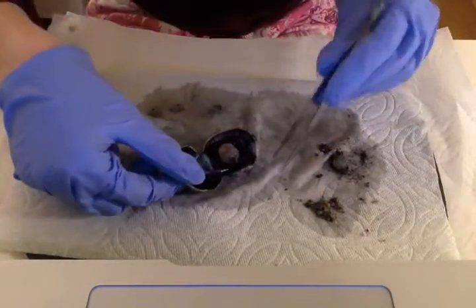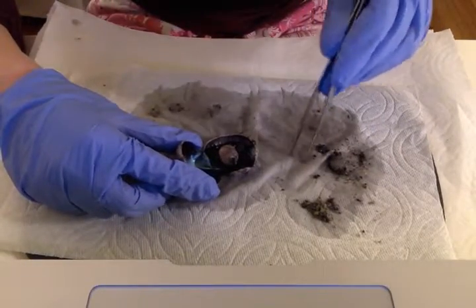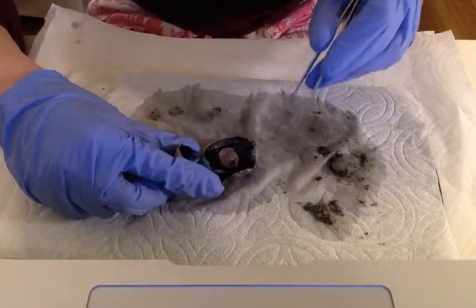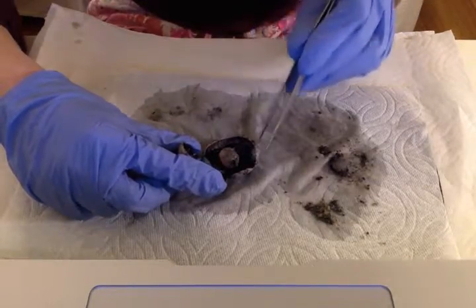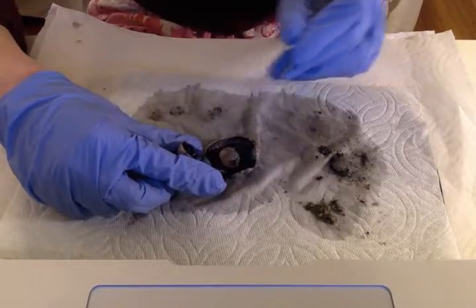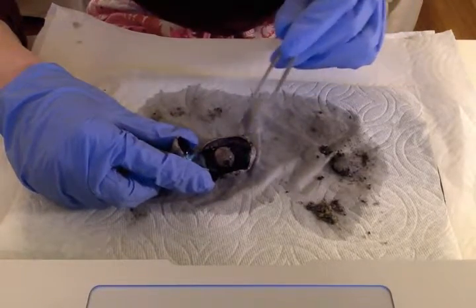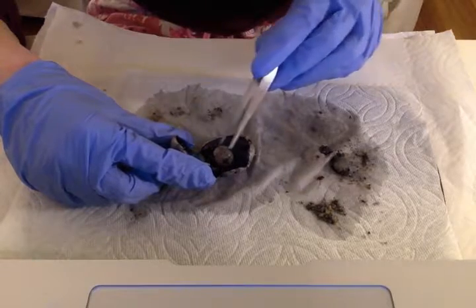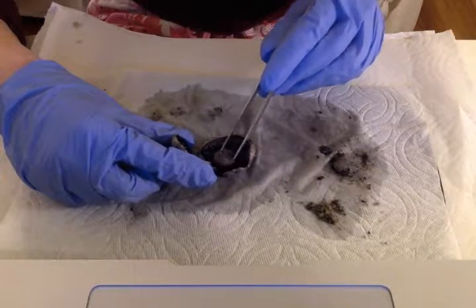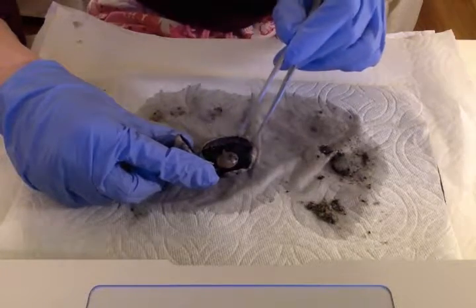So firstly, what I want to say about the eye. The eye is a hollow structure that's divided into two compartments. We have an anterior chamber or cavity and a vitreous chamber or cavity. Both chambers are filled with fluid, and they're separated from each other by the lens, which is this structure right here that I'll describe more in a second. So they're separated from each other by the lens of the eye.